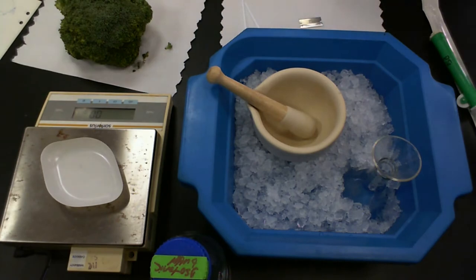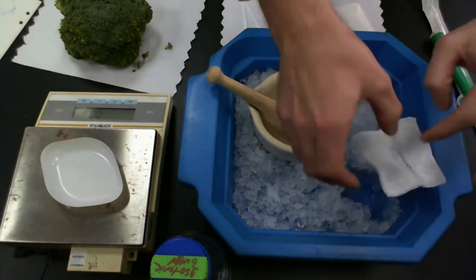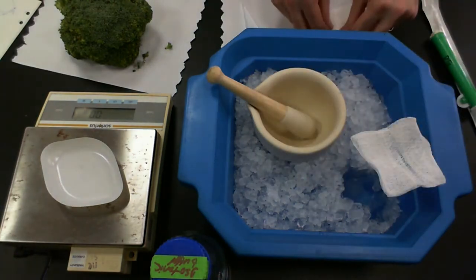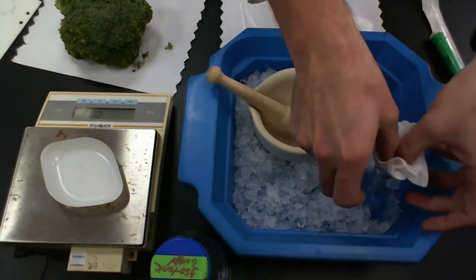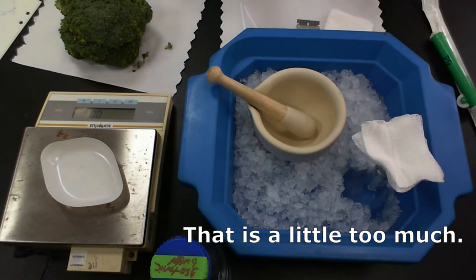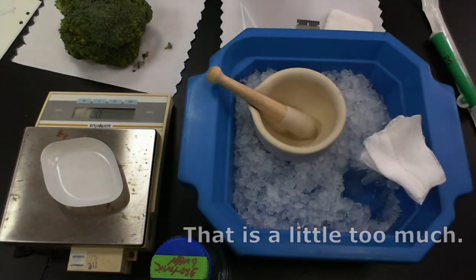I'm also going to need some cheesecloth, so I'm going to take a bit of the cheesecloth here and kind of fold it up. So I have about four layers of cheesecloth, maybe a little bit more right now. So it's a small funnel, so a small amount of cheesecloth, fold it over a few times will do.